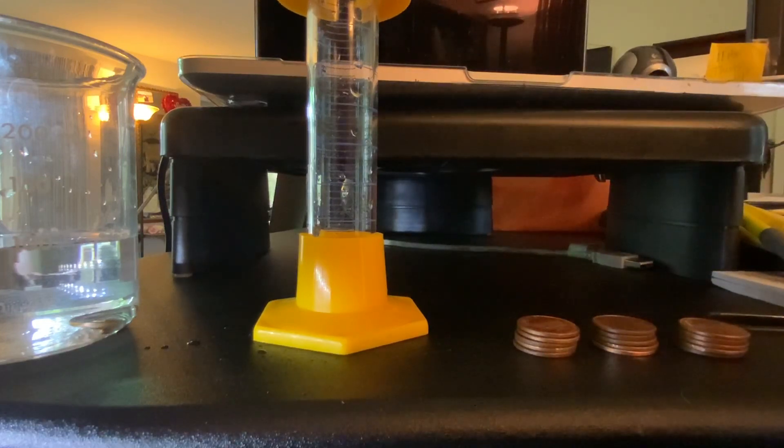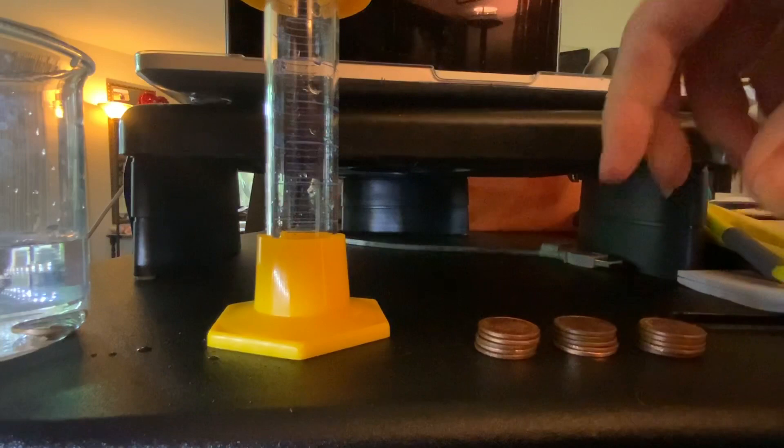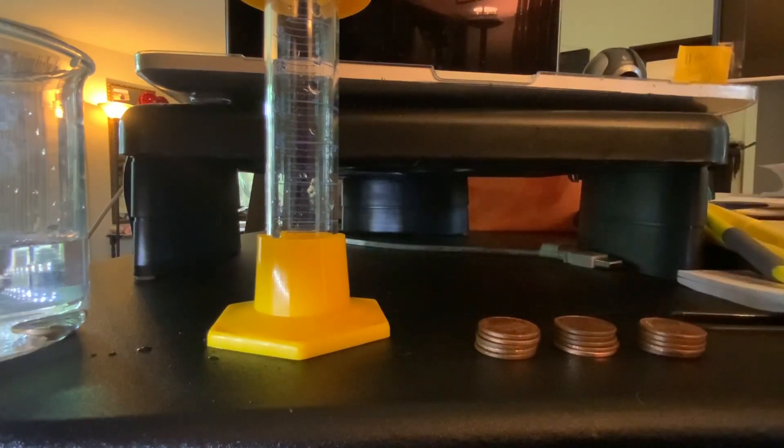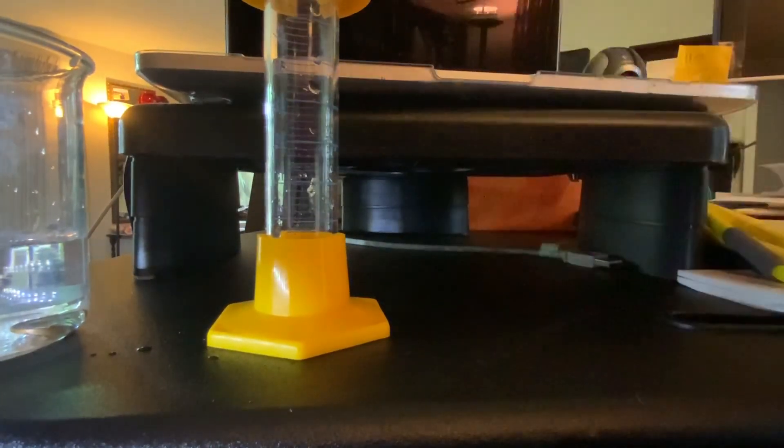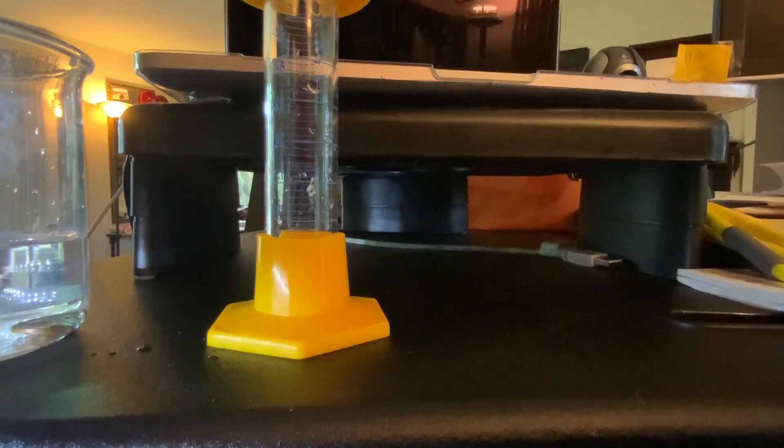Is that how many we're supposed to use? I think that's reasonable. I'm going to stick these on the balance. Oh, it turned off, so the balance reads zero currently. And here's the mass measurement.